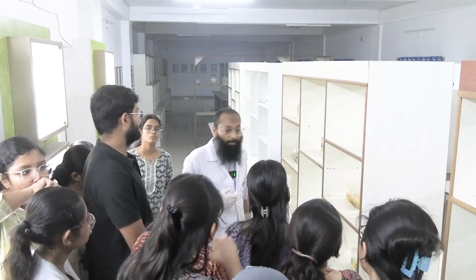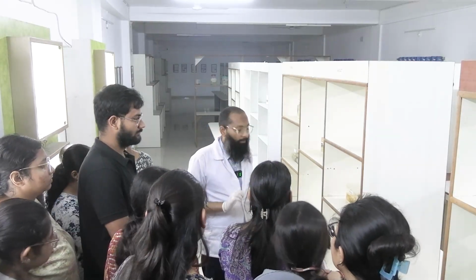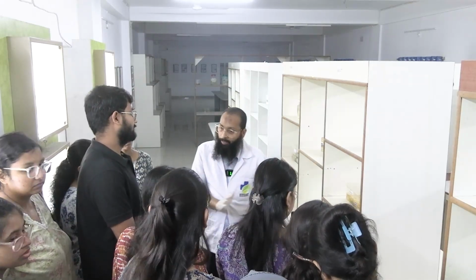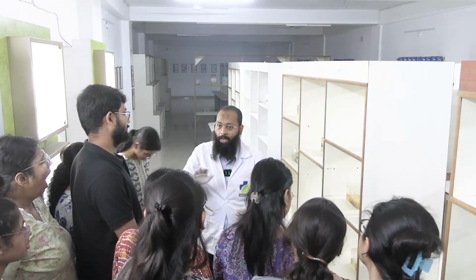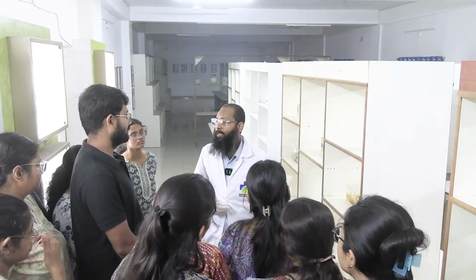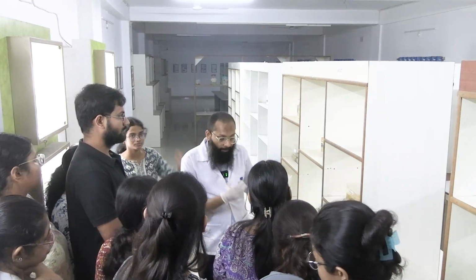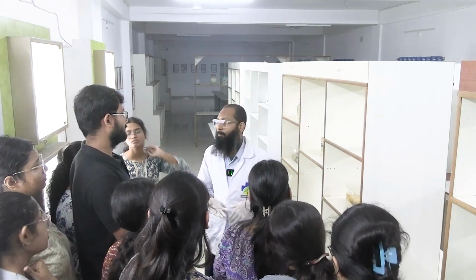Suppose a tissue has been taken out from the patient's body. Is this tissue getting the blood supply? Blood supply and oxygen supply have been cut off, and if this tissue is kept in any place, it will autolyze, it will get destroyed. It is actually in the phase of ischemia. So to prevent that, you should put it immediately in the formalin.